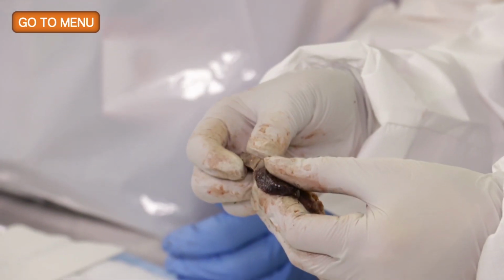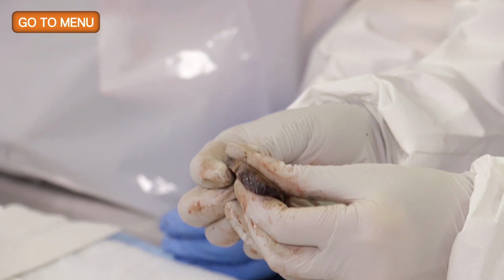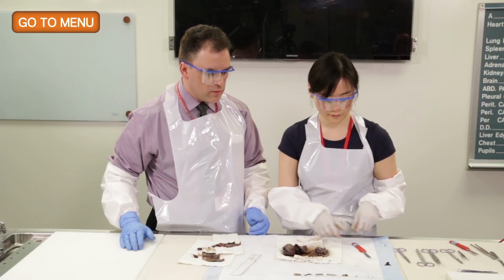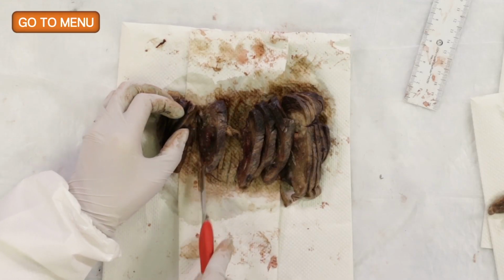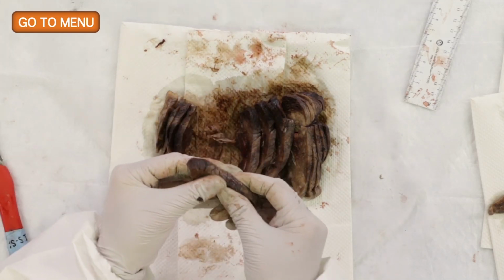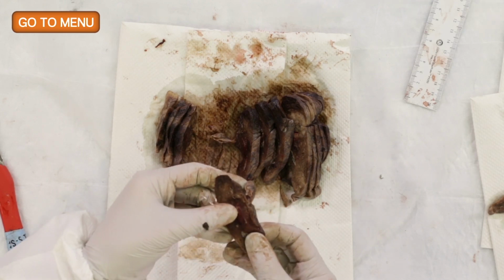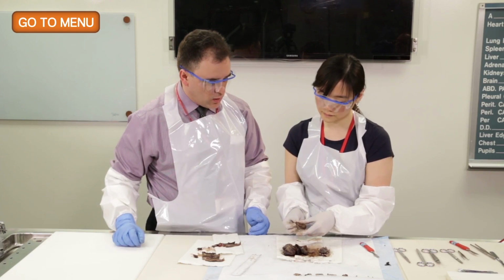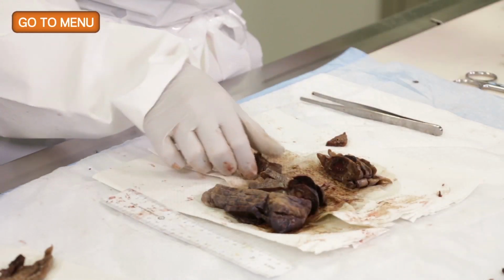So what I'm doing right now is that I'm looking for nodules, but not only am I looking for nodules, I'm feeling it. And I would say that the palpation is probably more important than even the visual inspection. So it's really critical that the technique that Esther is showing of holding the slice in her hand and rolling the slice in between her thumb and forefinger be done, because that's how we can feel a little nodule like a small ball within the specimen, which would direct us to taking a sample from that area. And so continue to inspect the rest of the specimen.